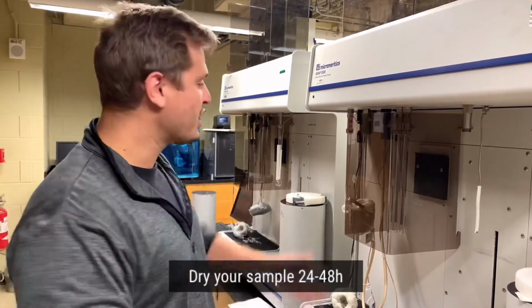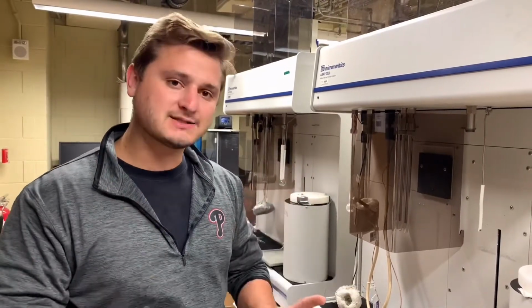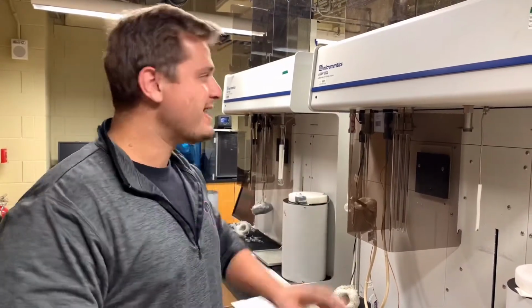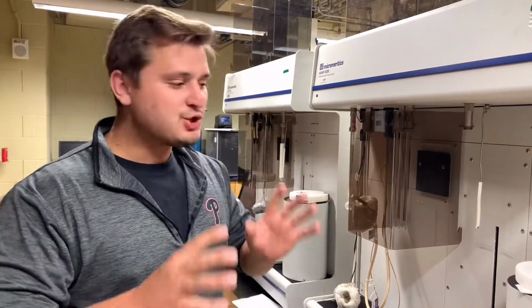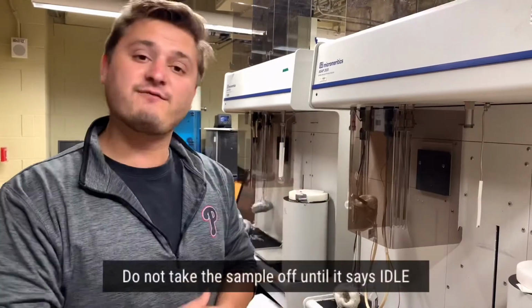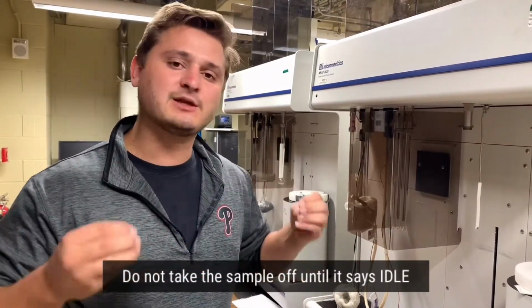I'm going to repeat again. You absolutely must dry your samples for either 24 hours or 48 hours before putting your sample on activation. This is an absolute must and a requirement within the Zhou Group in order to preserve the life of the instrument. The last thing is, you should not take your sample off of the instrument until it says idle, or that the sample file has been completed, and I will show you that in just a minute.